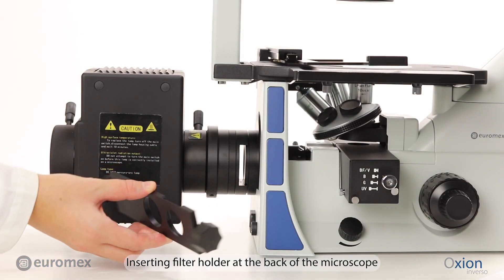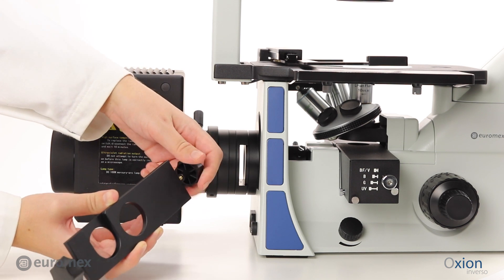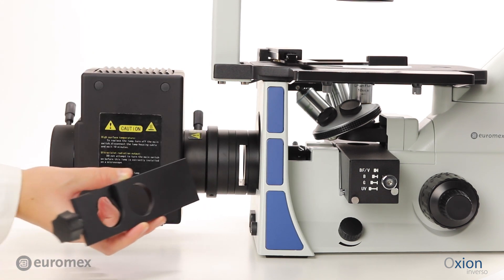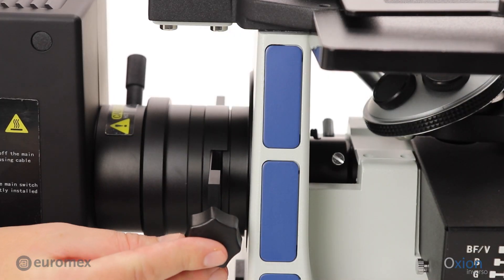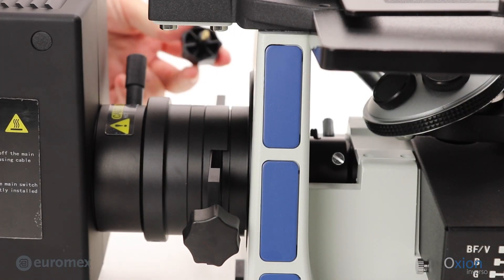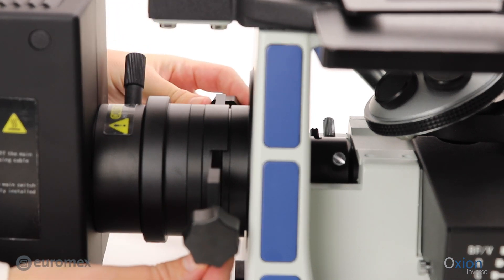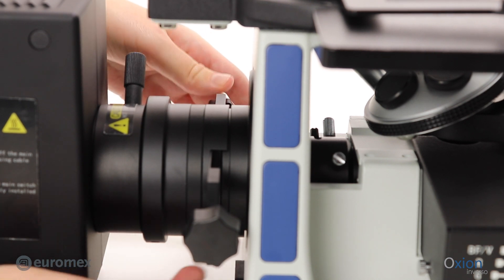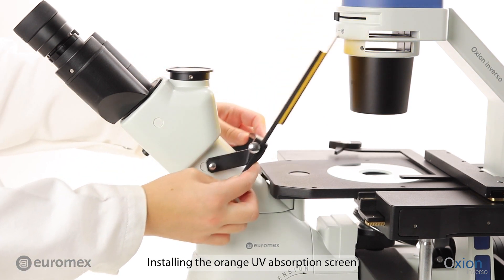Insert the filter holder at the back of the microscope. Installing the Orange UV Absorption Screen.